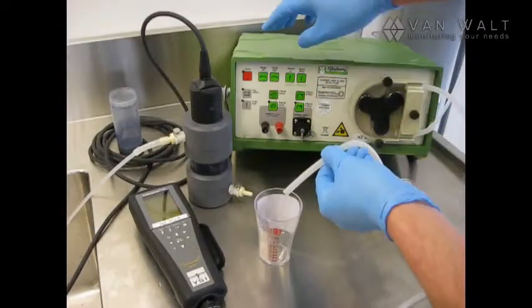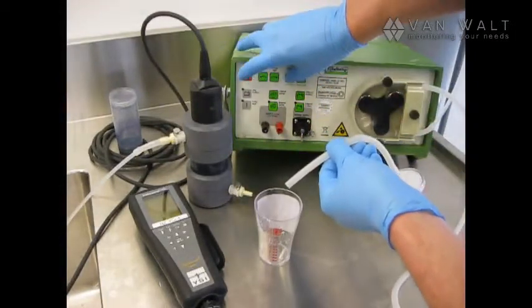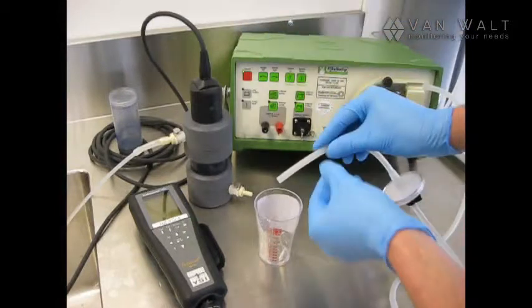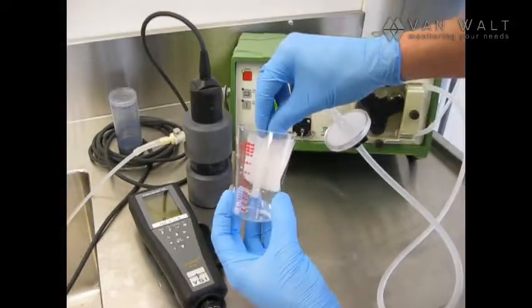And again, we can start the pump in memory mode. And we can do the same again.